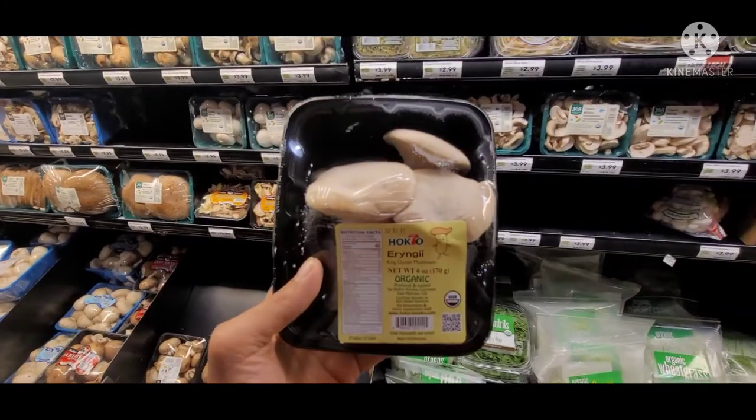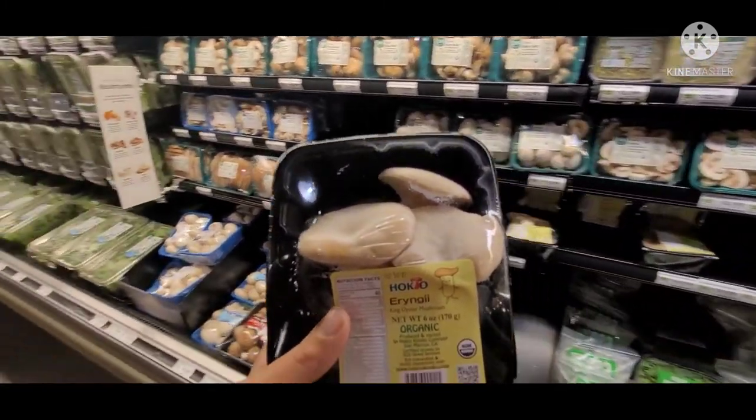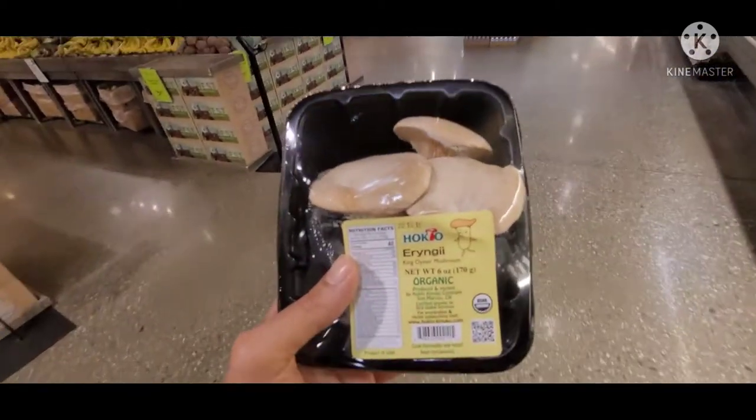In a second we'll go ahead and have part two of this where I'm putting this on the petri dish. So stick around.